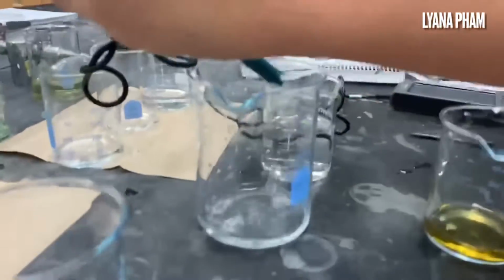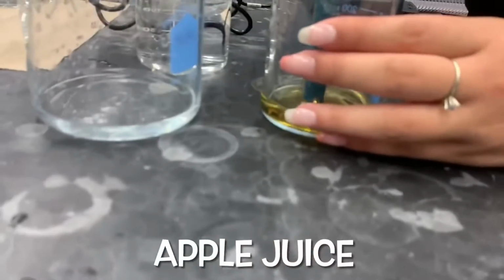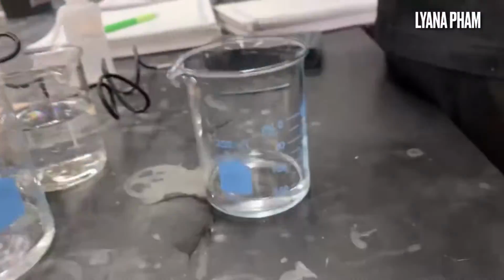In this segment, Lyana is seen testing the pH of her unknown solutions, the first of which was 3.58. She is then seen performing the proper procedure and test the pH of another solution, which was 11.01.